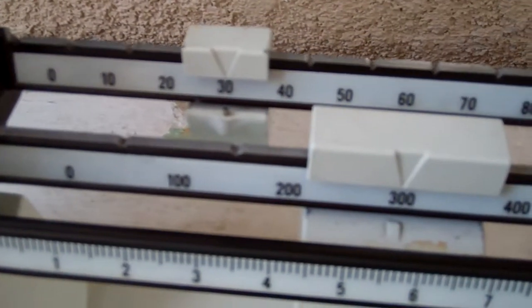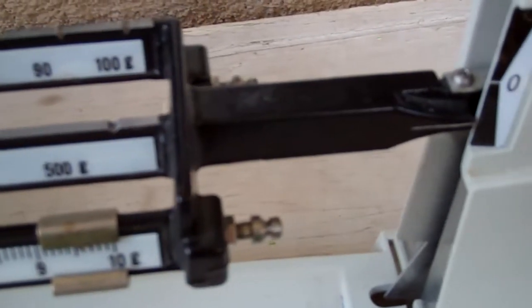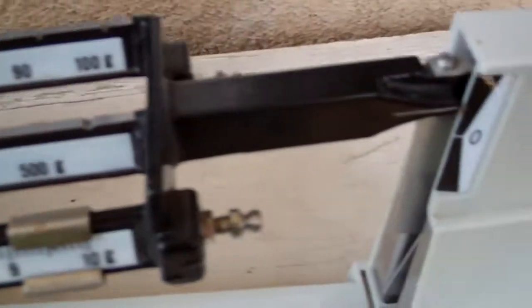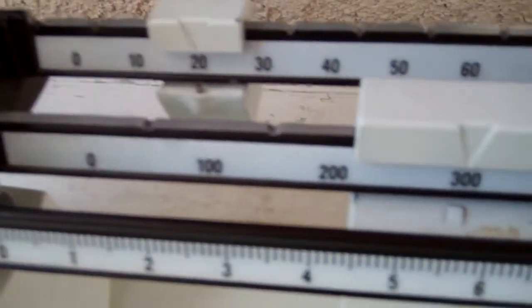So if I put it here, it goes down. Too heavy. If I put it here, it's up. Not the right amount. So it's somewhere around 320.